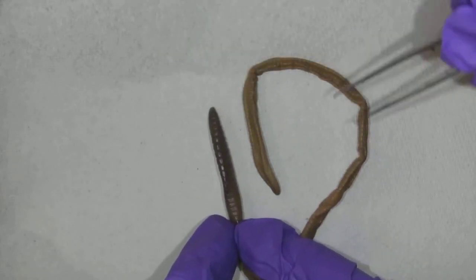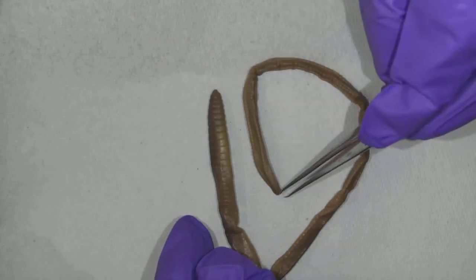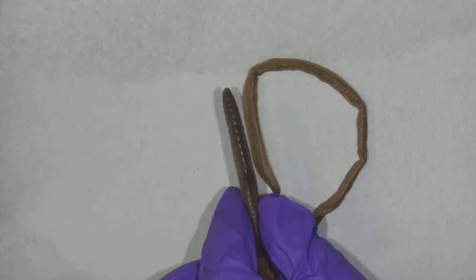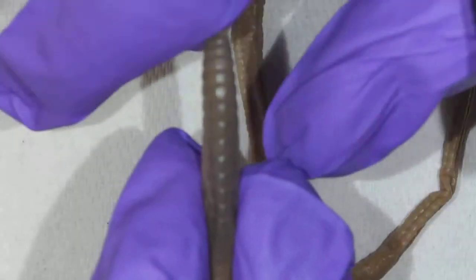All right, so when I look at my worm, I can tell he's one big tube, right? He's a long cylinder, and the ends do look slightly different. I'm going to start at this end here. Maybe I need to zoom in just a little bit. Zoom in, go to quick focus there. All right, are we focused? Try to focus one more time.